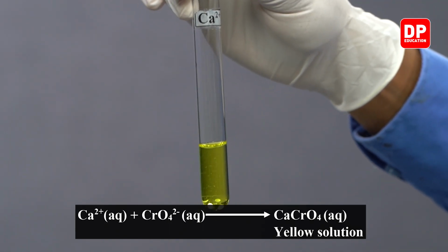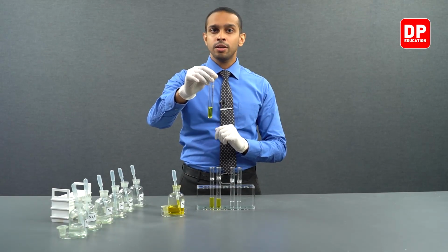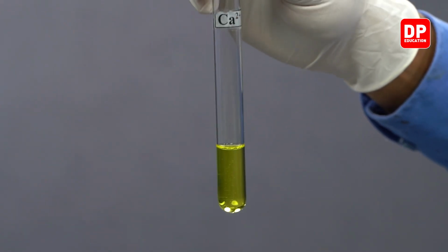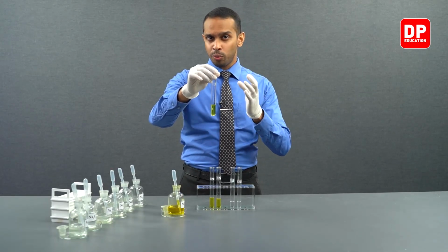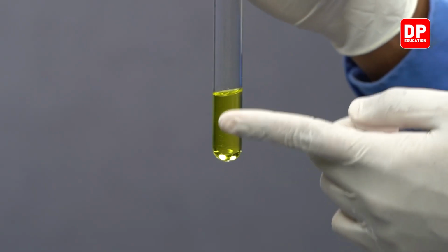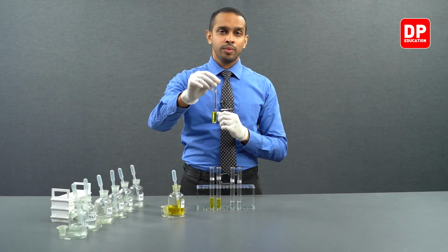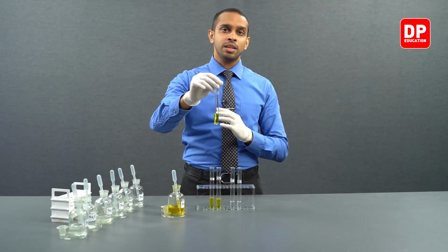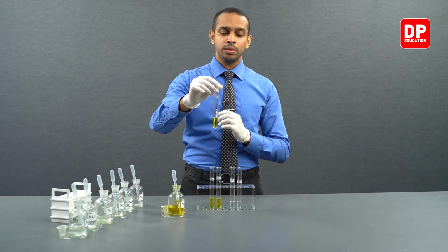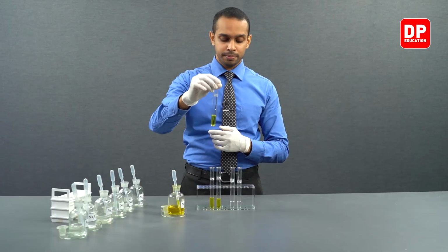This is because the calcium 2 plus ions in the presence of chromate anions will form calcium chromate, which is water soluble, which means the chromate anion is still present in this medium as an aqueous ion. An aqueous chromate anion will always give out a yellow color. That is why we observe this solution to be yellow in color here.